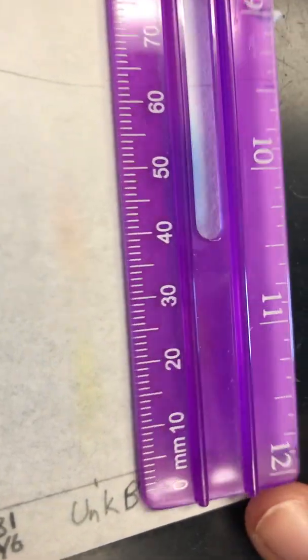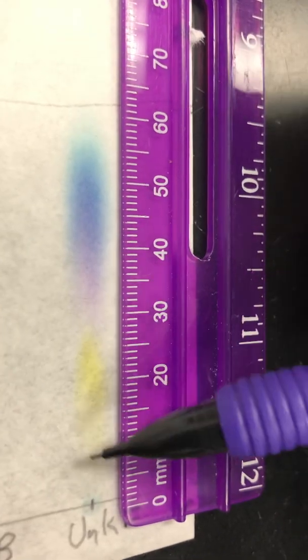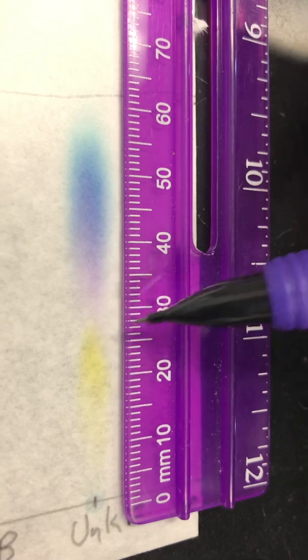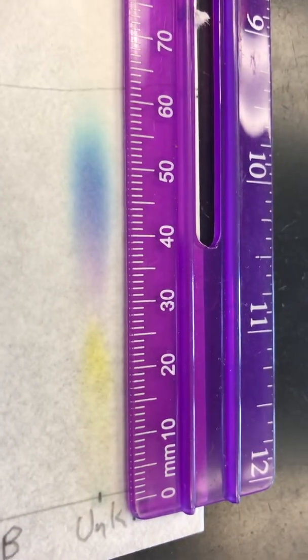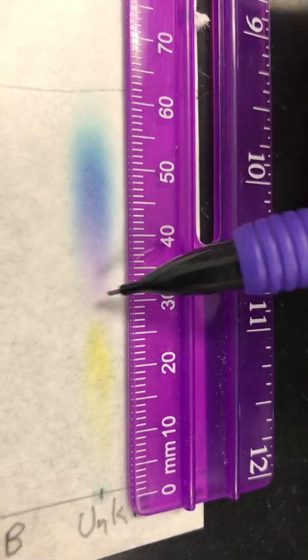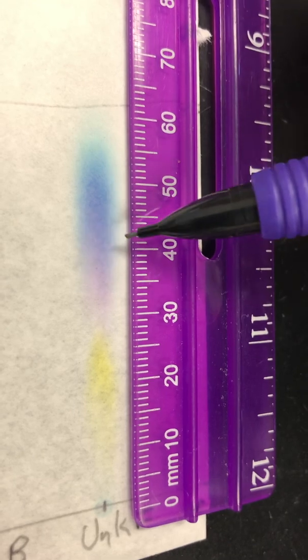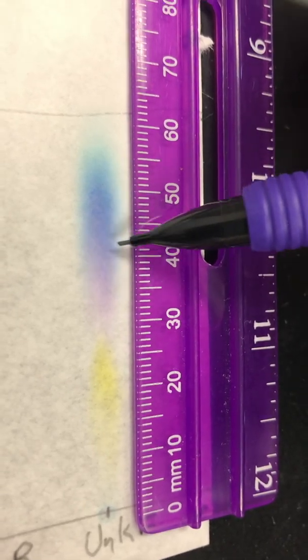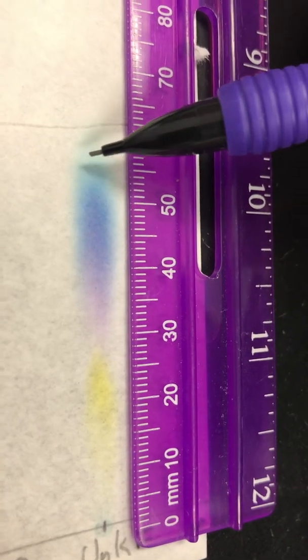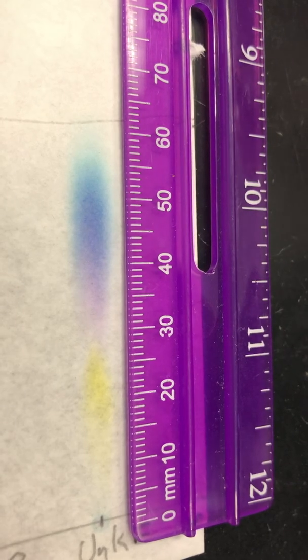All right, last one. Okay, so you've got first spots here, so right about there. Then here's your next spot. They bleed again together, so you can kind of see which one does a better separation between the 2 solvents. So that would be the top. And then your last one's top is right here. And then you could go ahead and get your D solvent.